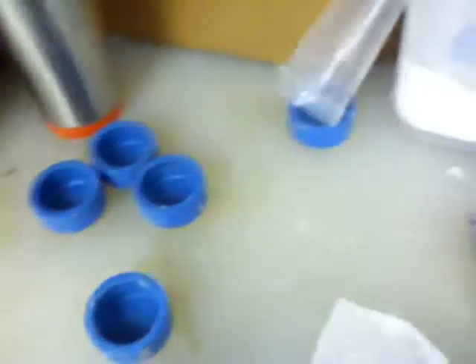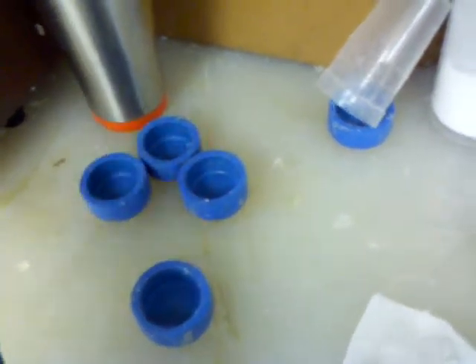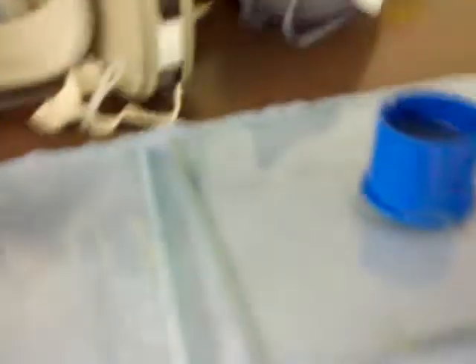I mix them up in these little cups right here — they're disposable. Then you pour the polymer in while it's still not as viscous, and then it sets. I've actually got two of them on glass plates. We used to just use these cups and they freestand — they came with little bottoms — but we needed the freedom that the glass plates allowed. It's actually setting; I'd turn it upside down right now, but I don't think it's gelled yet completely.